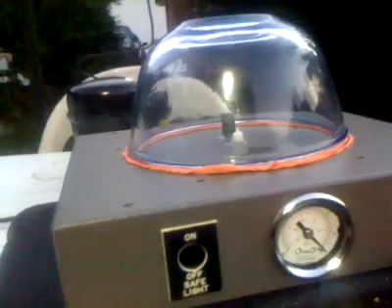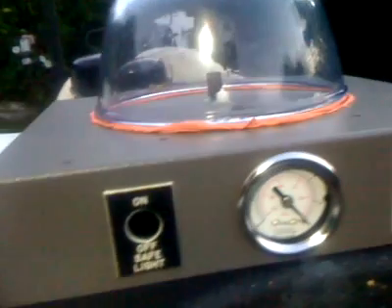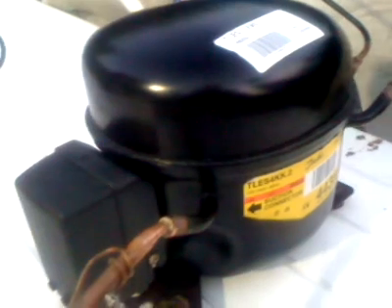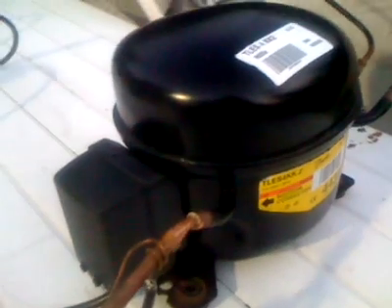Okay, I'm going to start the compressor, plug it in. Watch out for the noise, it's so incredibly noisy. There we go, that's running. Okay, gauge isn't moving at the moment, probably because I'm leaking around here, but as you can hear, insanely noisy. It's almost 10 o'clock at night, and the neighbours can't hear a thing. In fact, I've got a job to hear it. The noisiest bit is the outlet pipe, where I haven't done a tidy job of snipping this, and you can hear the outlet on the compressor is blowing away quite nicely.